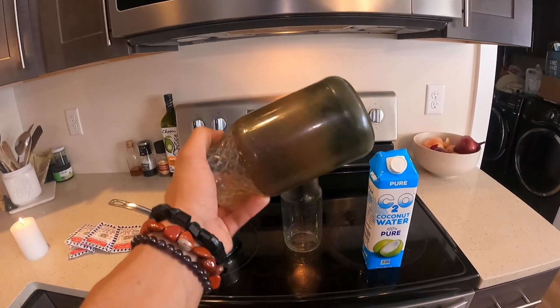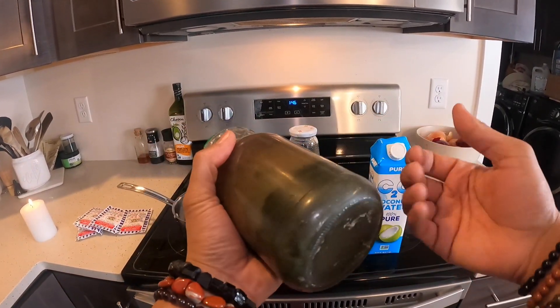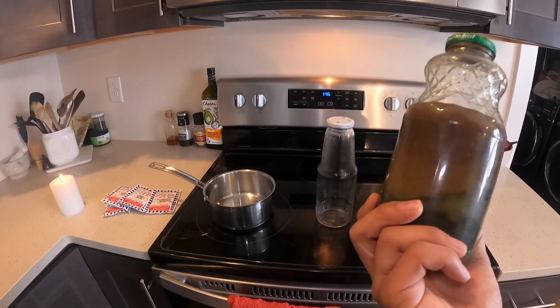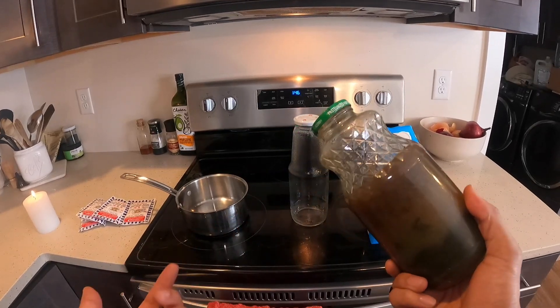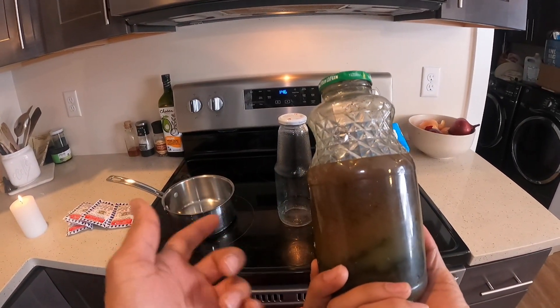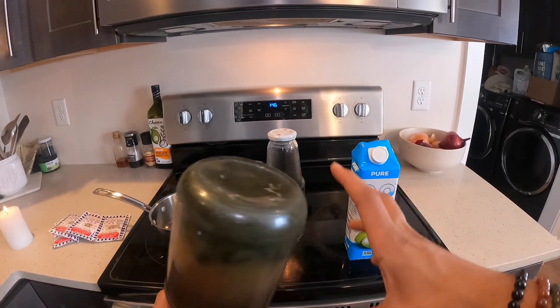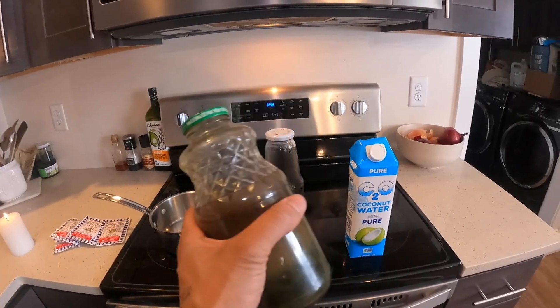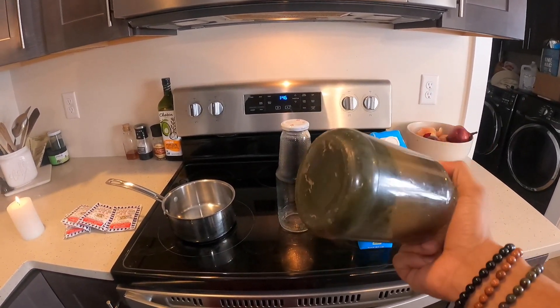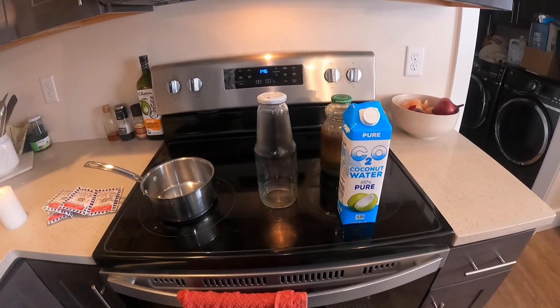In the back here I have some old nettle agar that has some flocculant and sediment. Agar, once it cools down, if you don't pour it, it'll solidify. But if it's not contaminated and you sterilized it well, you can reheat it and melt it again and then pour it. This looks a little janky but I'm going to melt this again and just use these plates for random things.